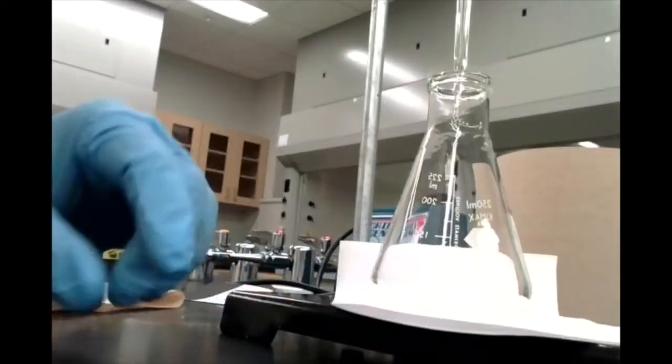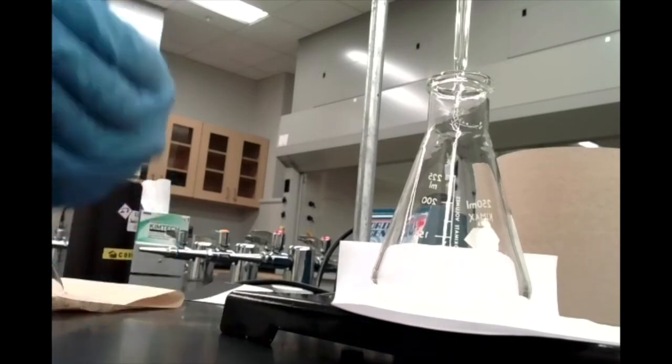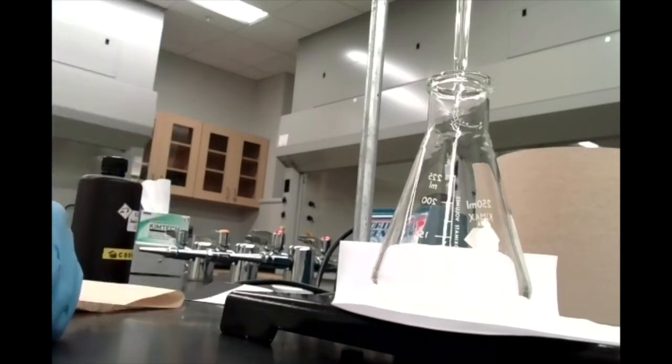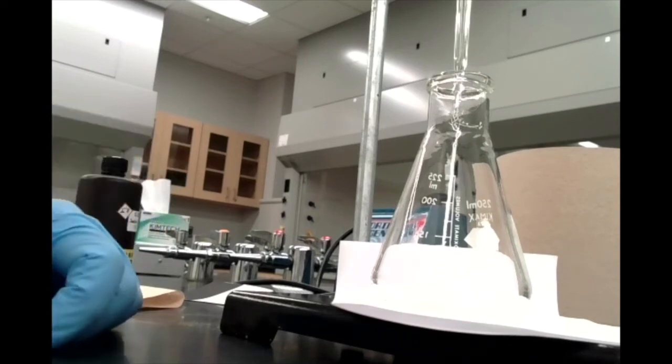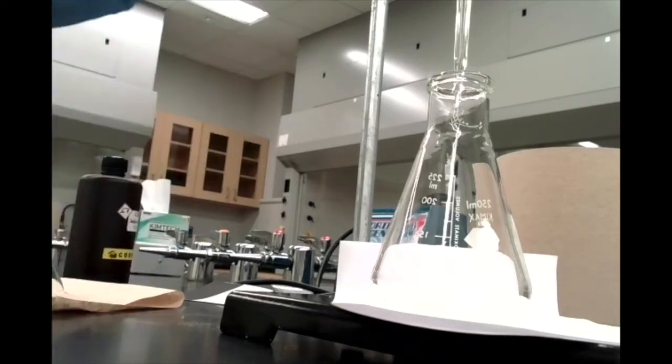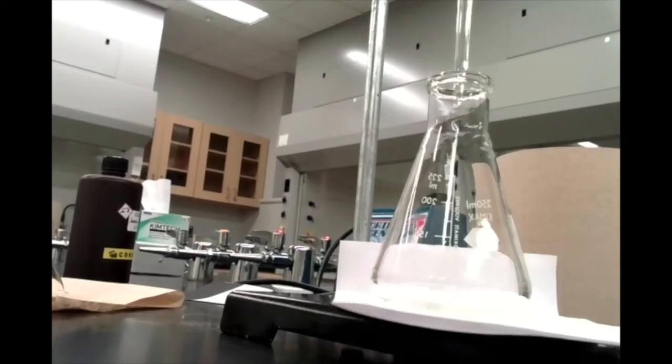Okay, so last trial. We want to try and nail down what our volume's going to be, and so let's go ahead and start running about 16 milliliters or so, just to go from there. So if we started at about 27 milliliters, if we add 16 to that, that should get down to about 43. So let's run this down to about the 43 mark here.